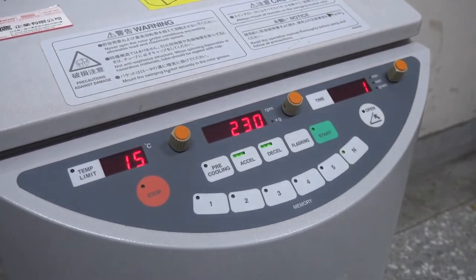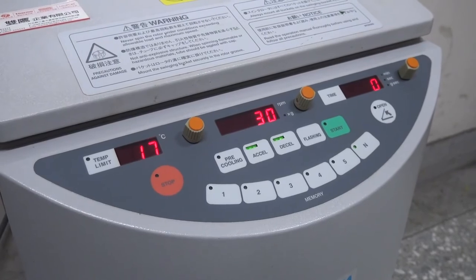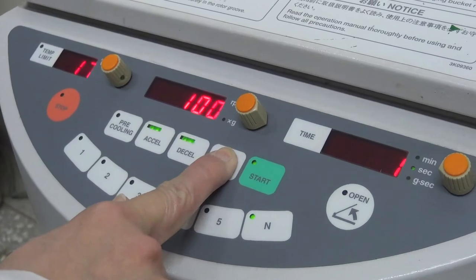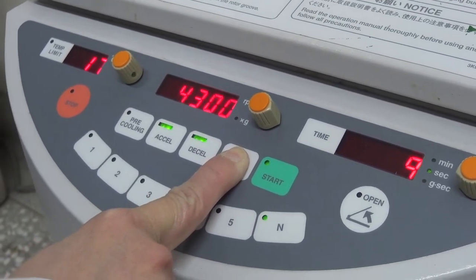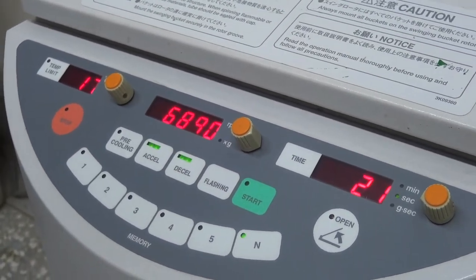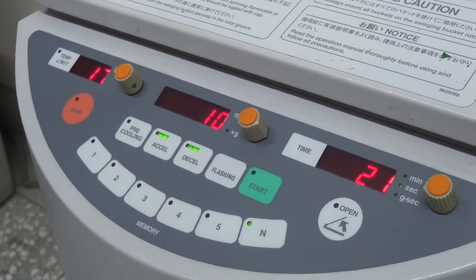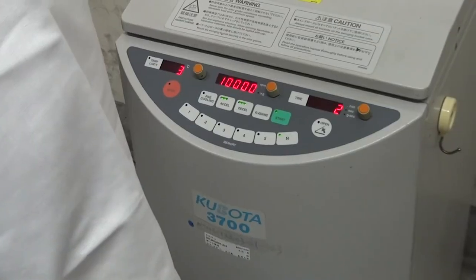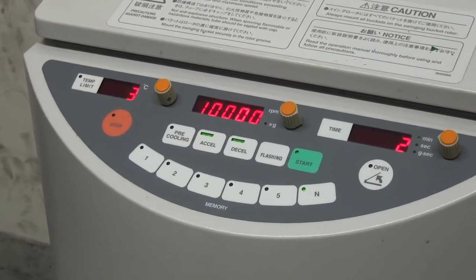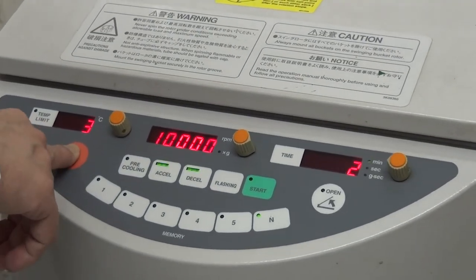At this time, the panel will display an increasing rotating speed and the time remaining. Please be patient and wait for the centrifugation to finish. If centrifugation for a short time is needed, press and hold the spin-down button after setting the rotation speed. Let go of the spin-down button several seconds after the rotation speed is reached and the rotating speed will slow down to a stop. For safety, please only leave the centrifuge after it is running normally. If sounds of abnormal rotation are heard or the centrifugation must be terminated halfway, press the stop button.